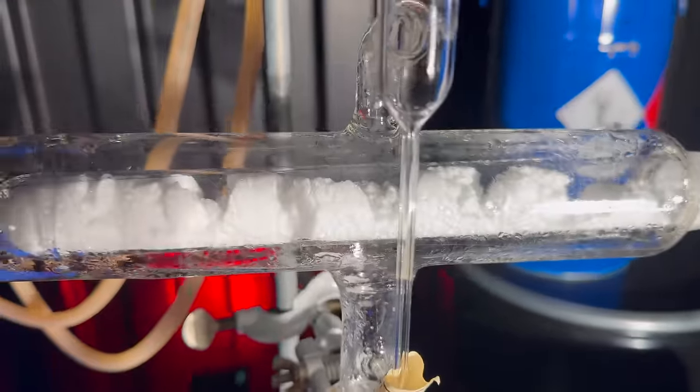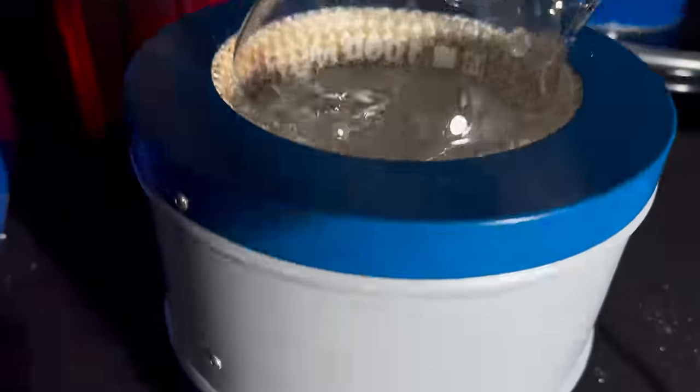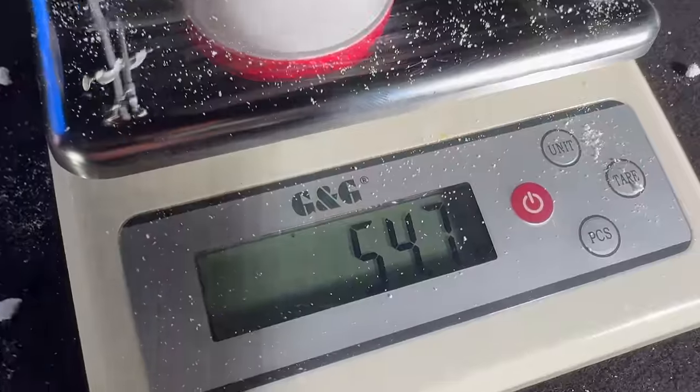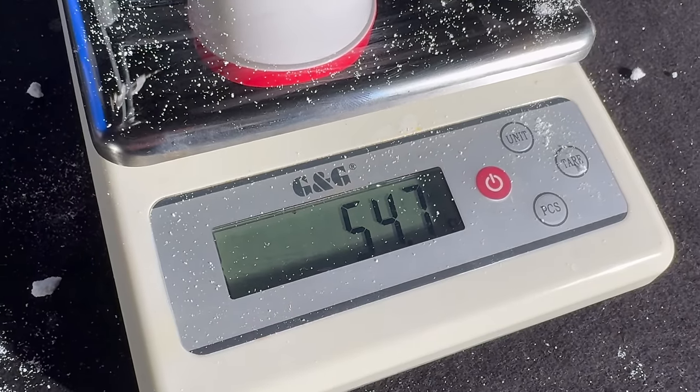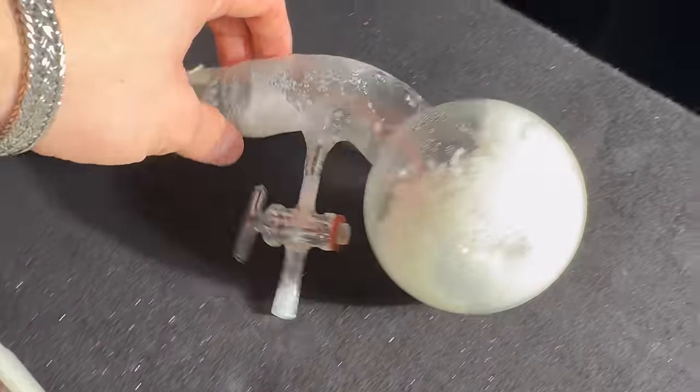91 minutes and 3 and a half seconds in, no more water came over. I stopped the process and weighed out the oxalic acid. While taking a last look at the desiccant before throwing it away, I see that it looks decently wet.